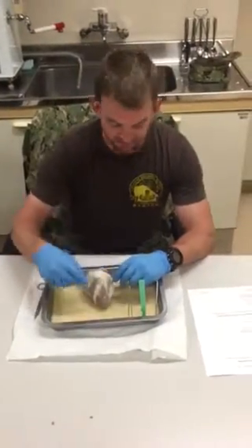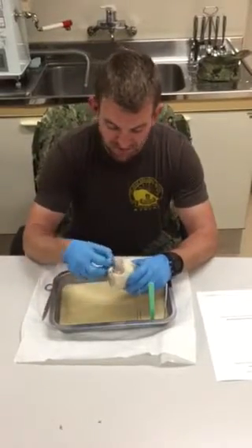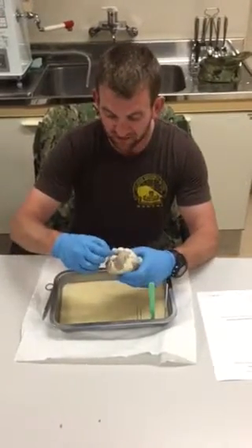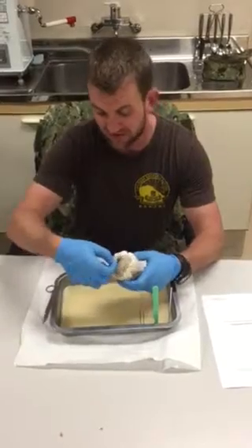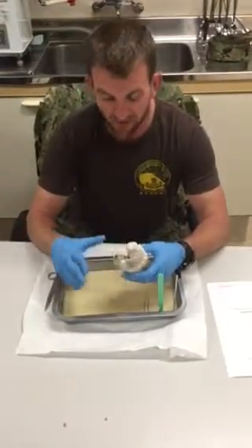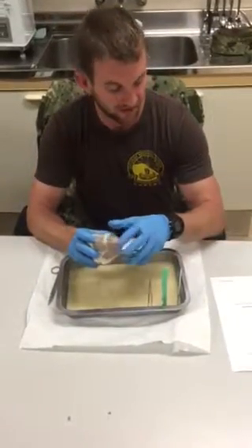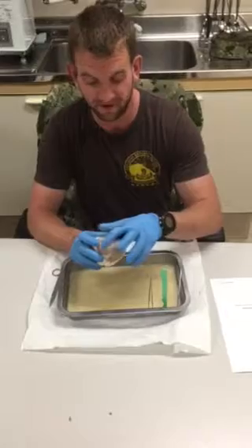To begin with the anterior, the pericardium and epicardium. There isn't much left on here, but if you look up here at the base of the heart, you can see remnants of the pericardium as well as the epicardium. The flat top being the base, and then down here, the inferior side of the heart is known as the apex.